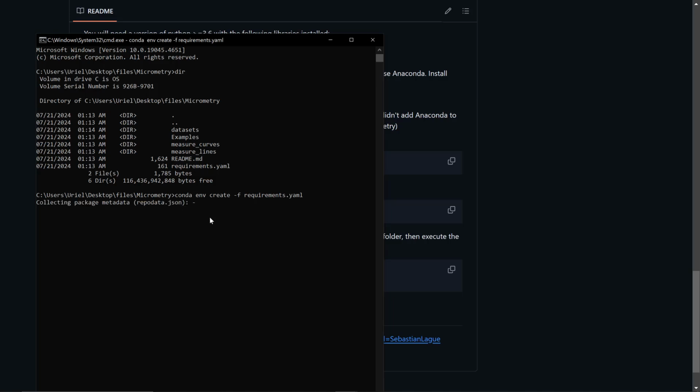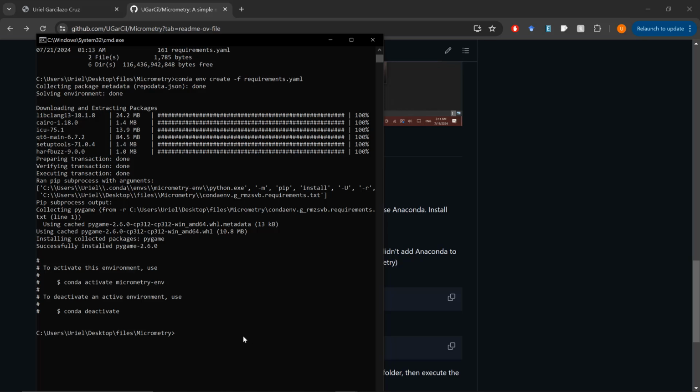After a while, how long it depends really on how good your internet is and how much processing power your machine has, but after a while you're going to end up with a new environment. And once we have it, we can run Micrometry right away. Okay, so for me it took around 5 minutes, in the time in which it had to find OpenCV. Probably that's the library that takes the longest to find, but then it gives us instructions on how to activate and deactivate our environment. So let me show you what we can do with this.